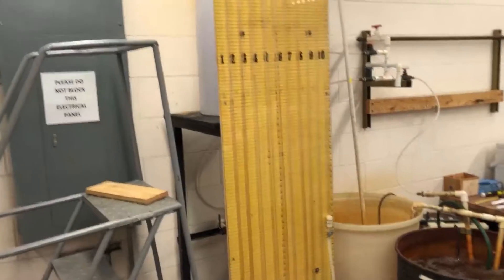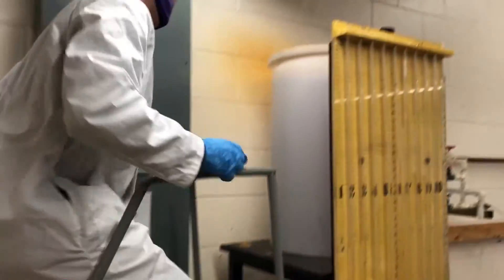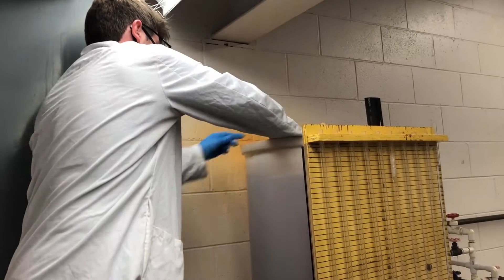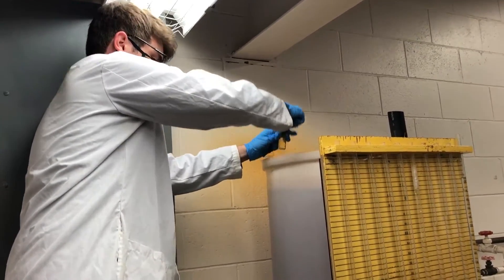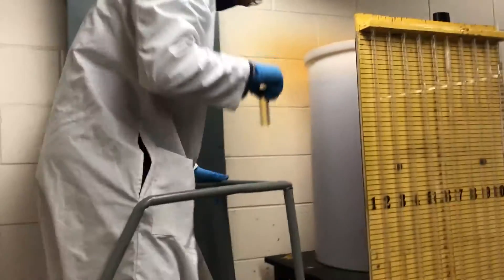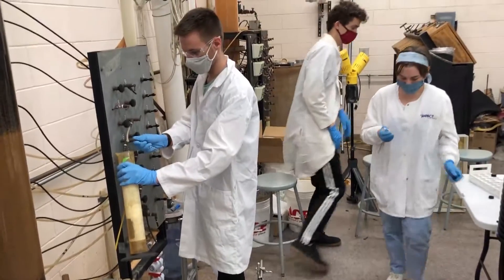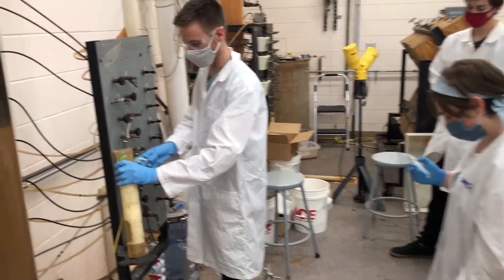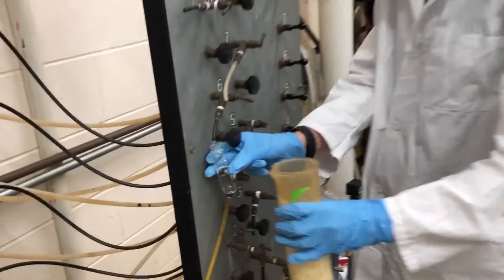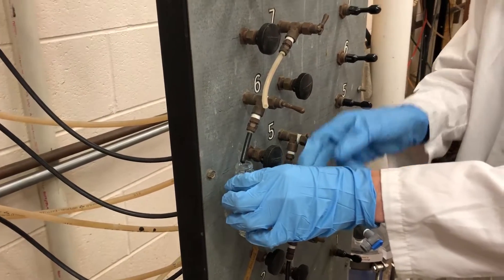To measure the feed turbidity, all we're doing is reaching into the top of the tank and collecting a sample. It's sample time — everybody's lining up to take their sample. Right here we've got number six. Wow, number six is really just trickling out.